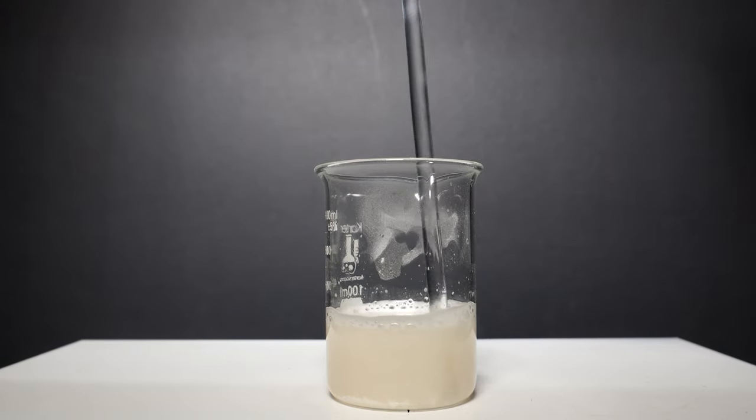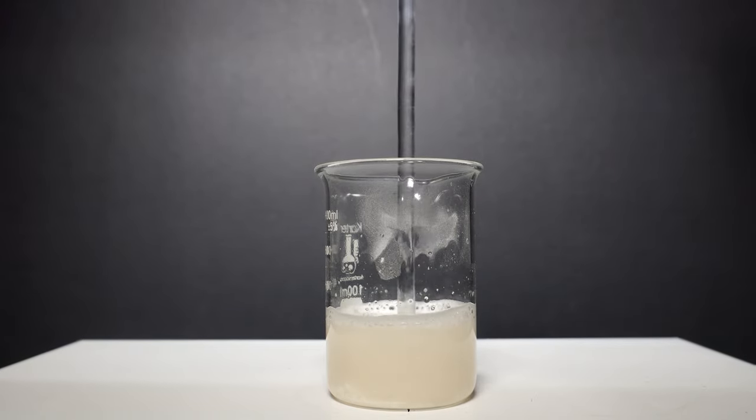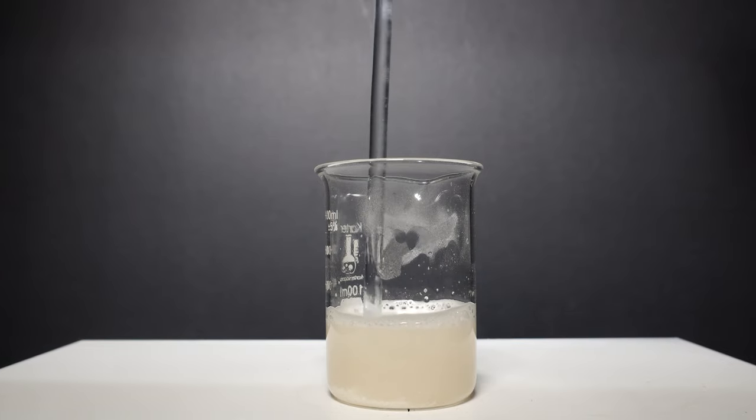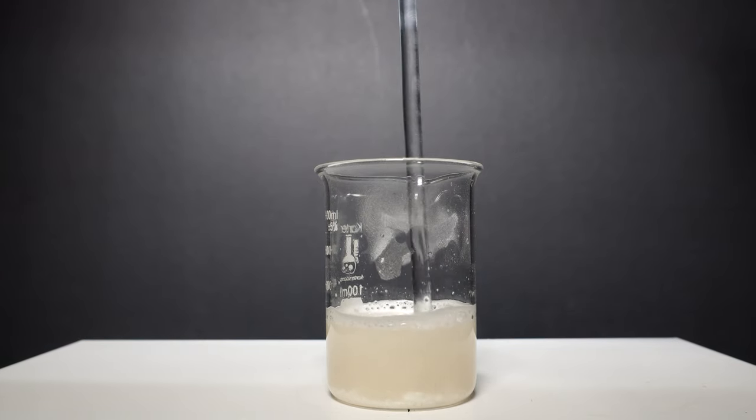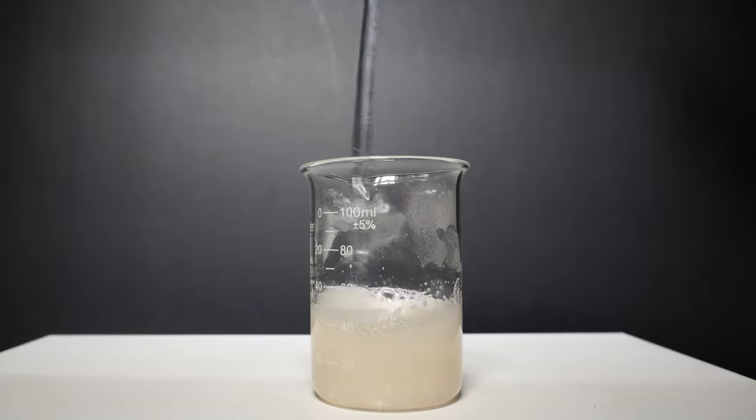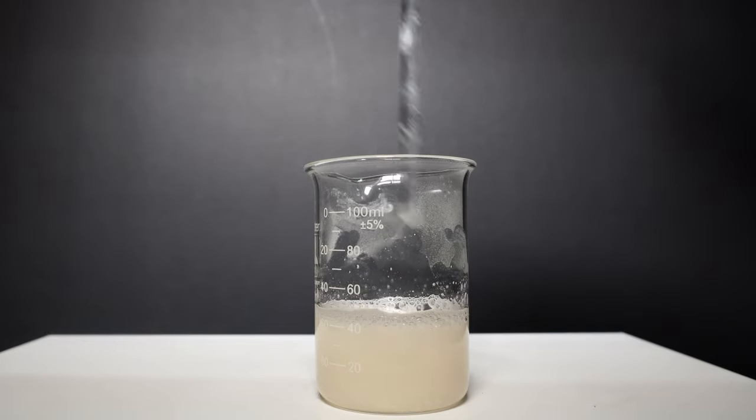It's inevitable that there will be some undissolved powder left. This is fine and won't really matter. Though we could filter off the solution, I just allow the particles to sink to the bottom and decant the upper water layer.